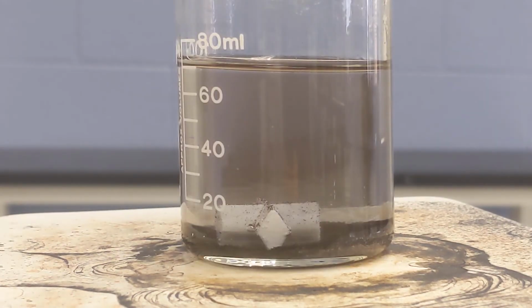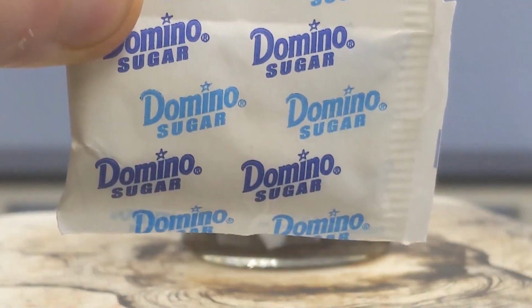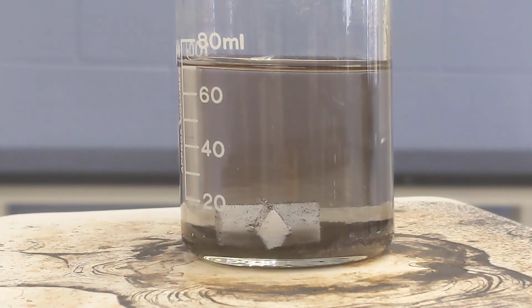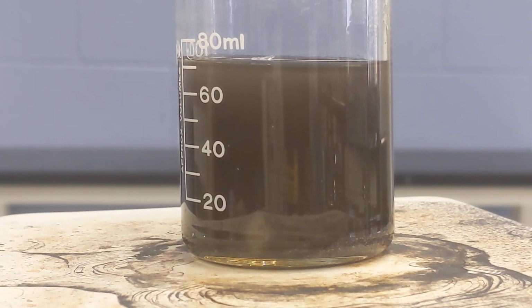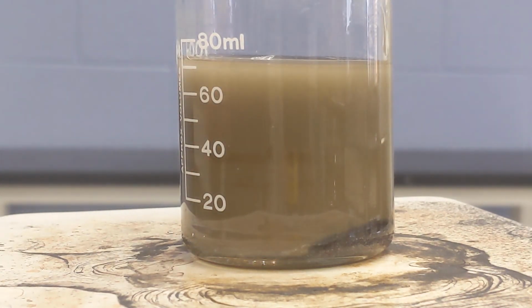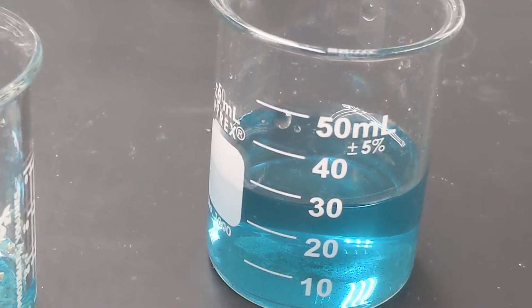And so now it's as reacted as I care to make it. And what I'm actually gonna add is sugar, regular sugar. You can use dextrose or corn syrup, but it's the sugar that's actually going to reduce the silver into its metal. I'm actually not really sure if this process worked as it was supposed to, and you'll see in a moment, but you'll also see that it doesn't really matter because I decided not to go with this method. Because I remembered that way long ago, back in high school, there was another method I had used to get silver.